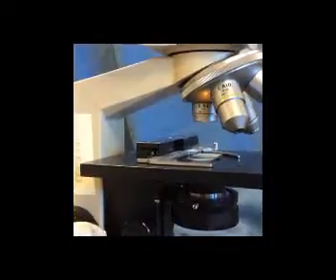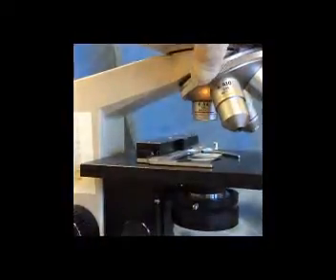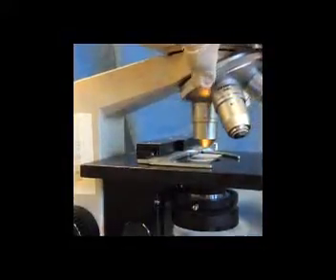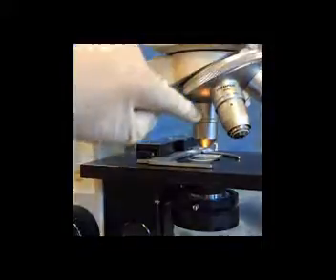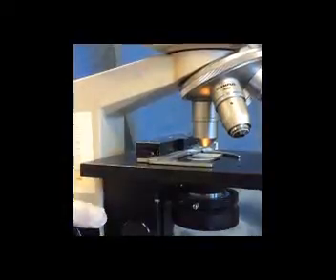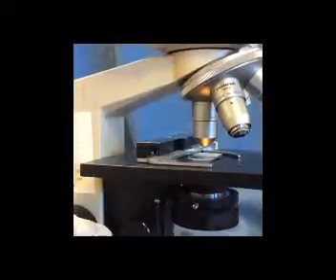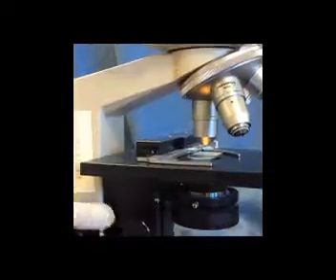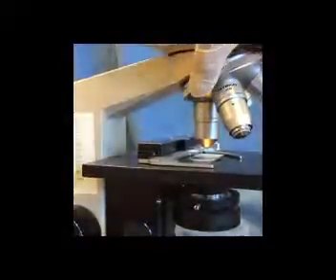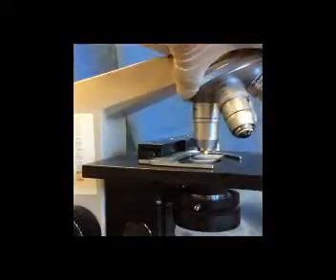Okay? So I'd be looking through my oculars. I'm going to bring my microbe into focus using coarse focus adjustment. Then I'll revolve the turret, or revolving nosepiece, or rotating nosepiece. That click is important because it's telling me now that my low power lens is in alignment with the lens and mirror systems above. And now in theory again, the microbe should be in focus, but I might need minor adjustment of focus, so I could use maybe a minor adjustment using coarse focus or minor adjustment using fine focus. Now once the specimen is in focus there, again looking from the side, we're going to rotate and bring our high dry, our 40x lens into place.